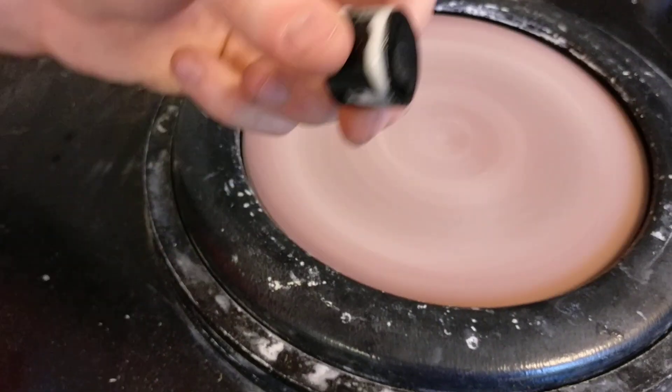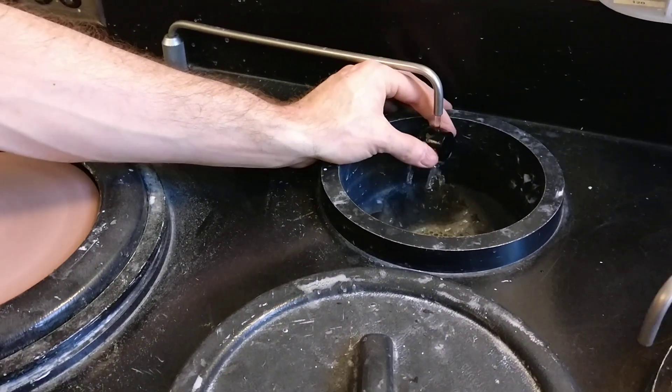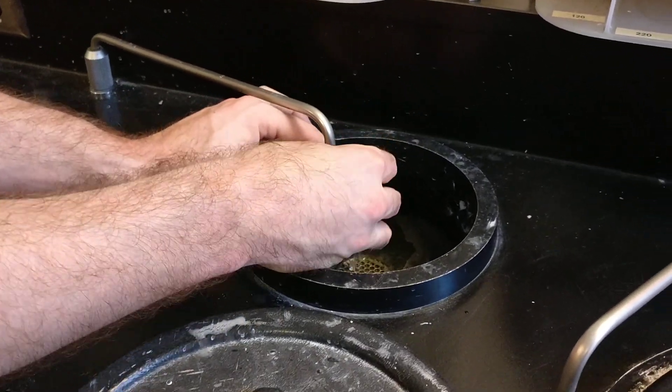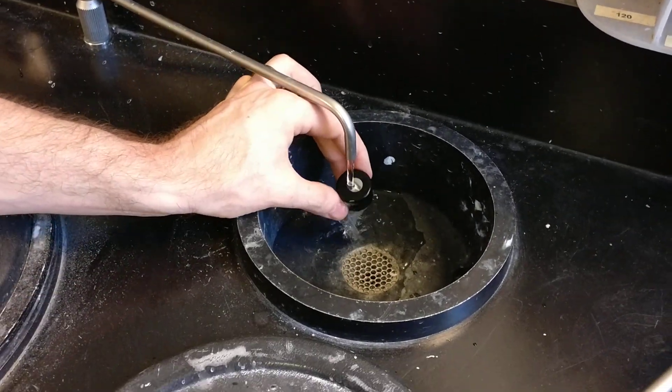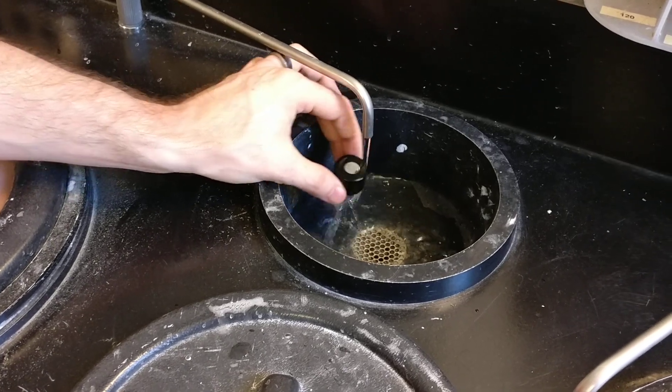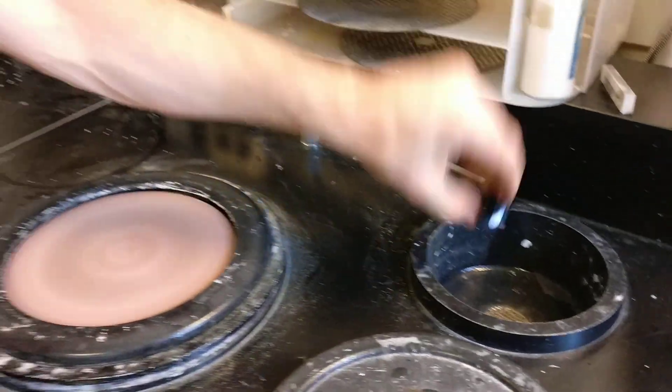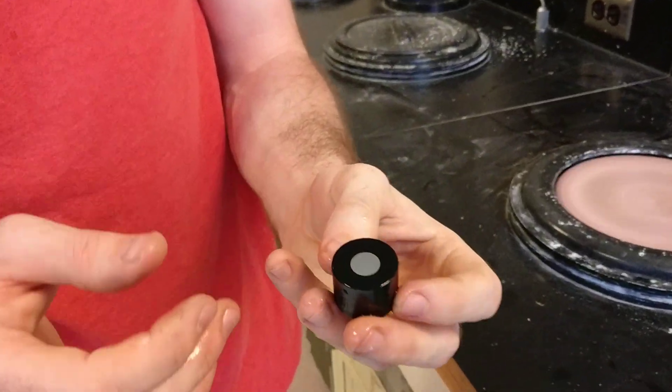After your sample is polished, we're going to rinse it under the sink. If you have some alcohol, then you can dry it off.